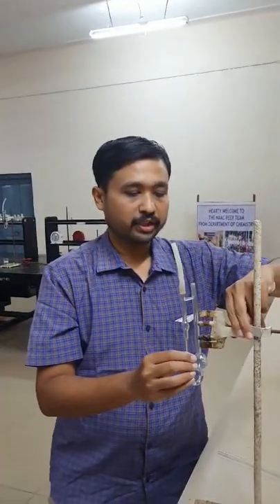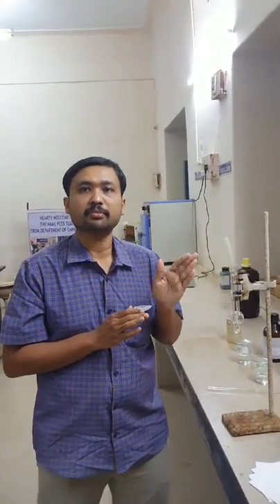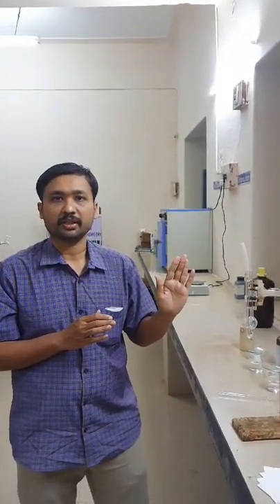By doing this, we have recorded the time of flow of the liquid and the time of flow of water. From Part A, we have the density of the liquid at lab temperature. The density and coefficient of viscosity of water are known values, provided in a chart. Knowing these five data points, it is possible to calculate the coefficient of viscosity of the given liquid. This same procedure applies to any organic liquid — ethyl acetate, toluene, or any other. I hope you have understood the procedure and will perform the experiment accurately and safely. Thank you.